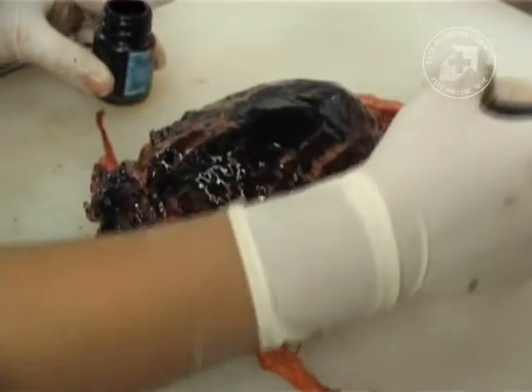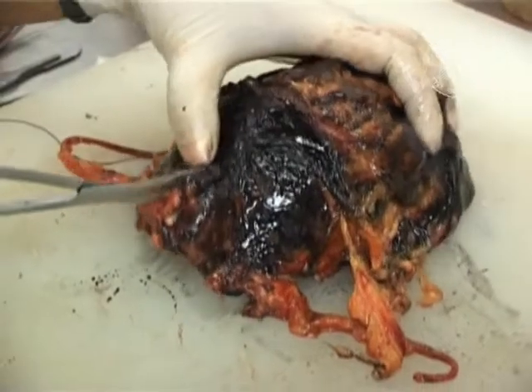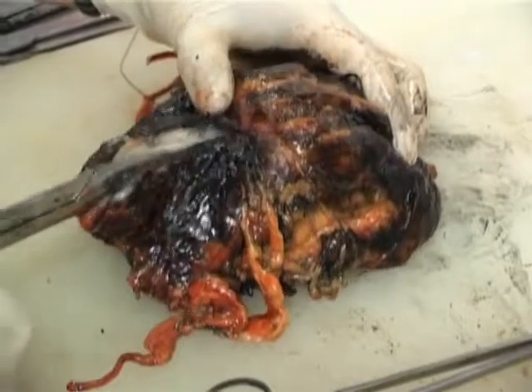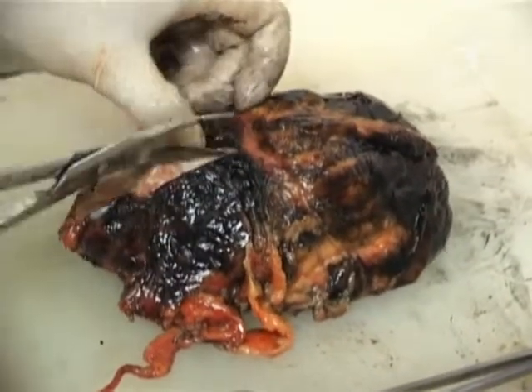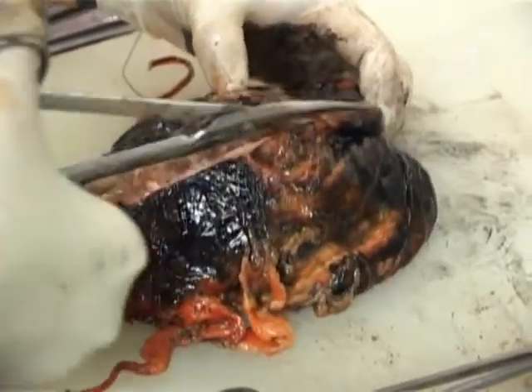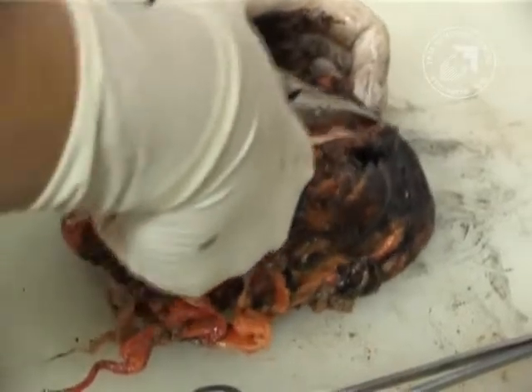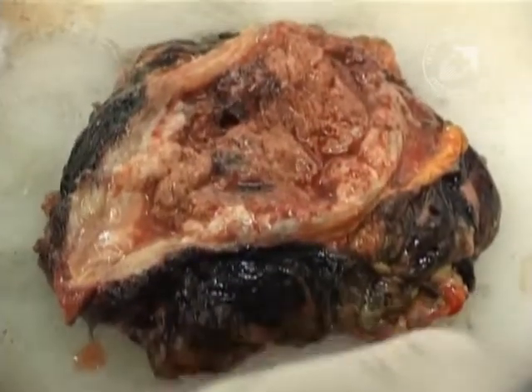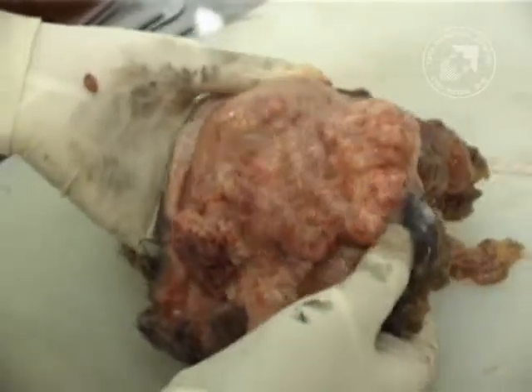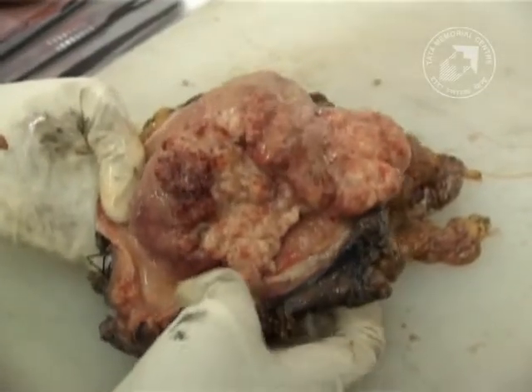We continue to ink the whole of the specimen. Next we start opening the bladder by cutting open the anterior wall through the distal urethra, cutting till the dome of the bladder using sharp scissors. You can see that the tumor is filling the whole of the lumen of the bladder with a lot of exudate. This is the everted bladder, just to demonstrate the large polypoid papillary tumor.